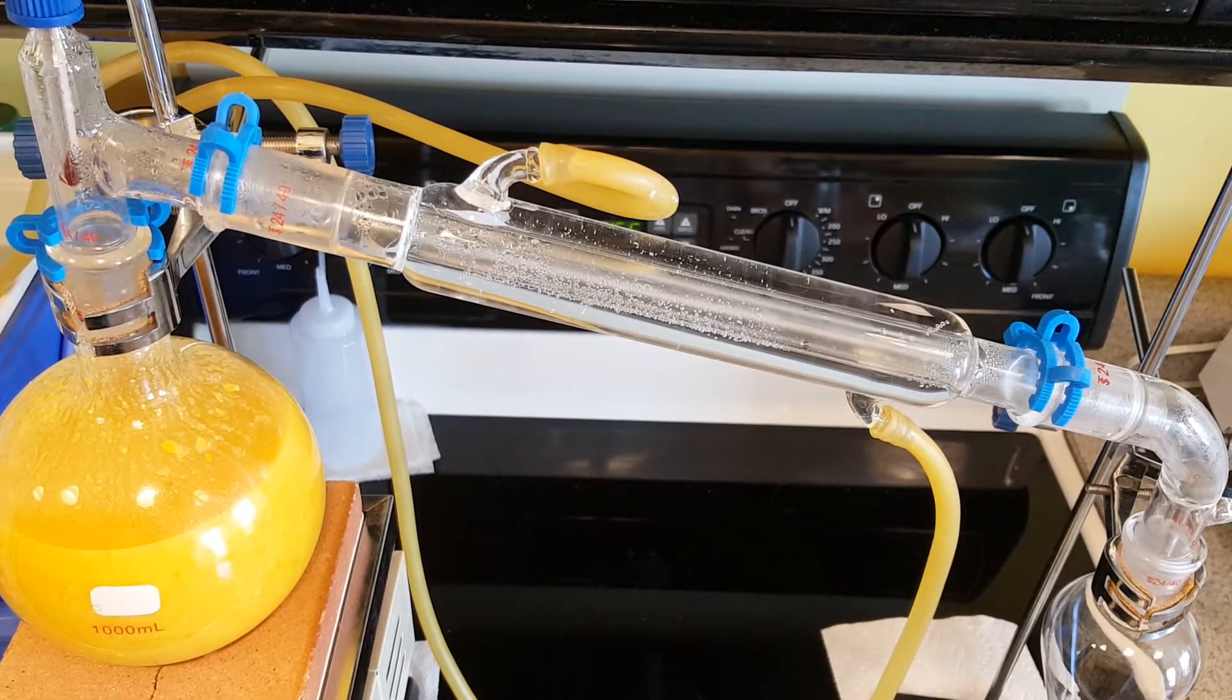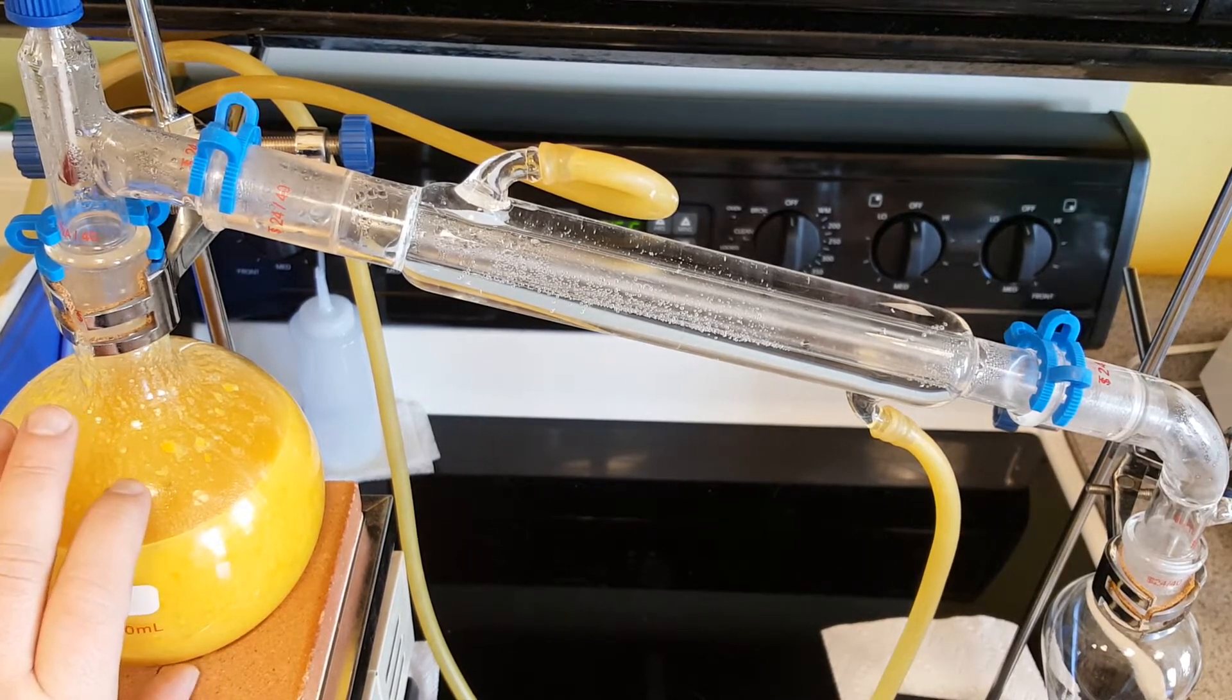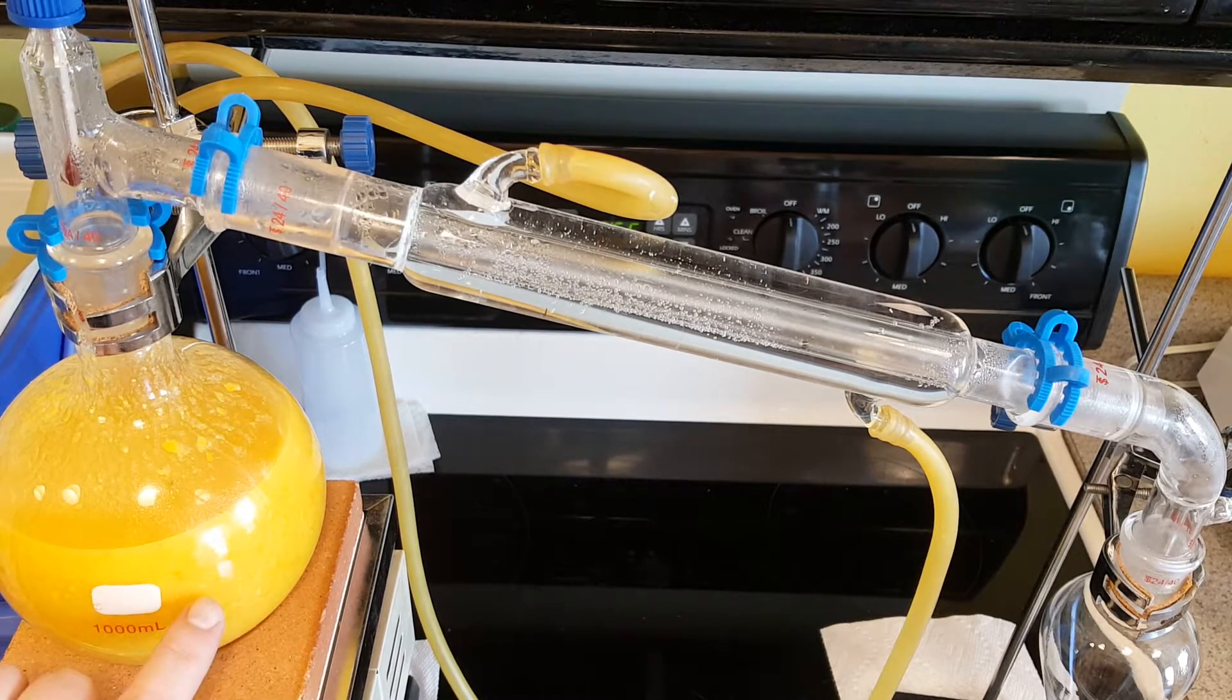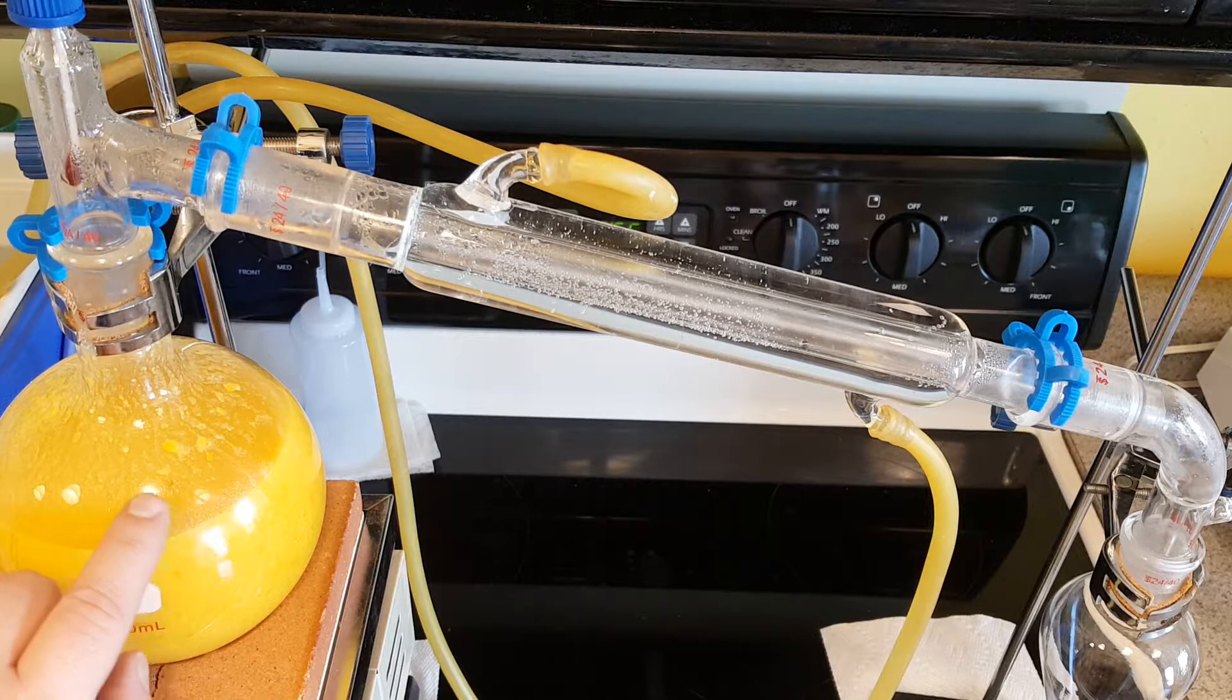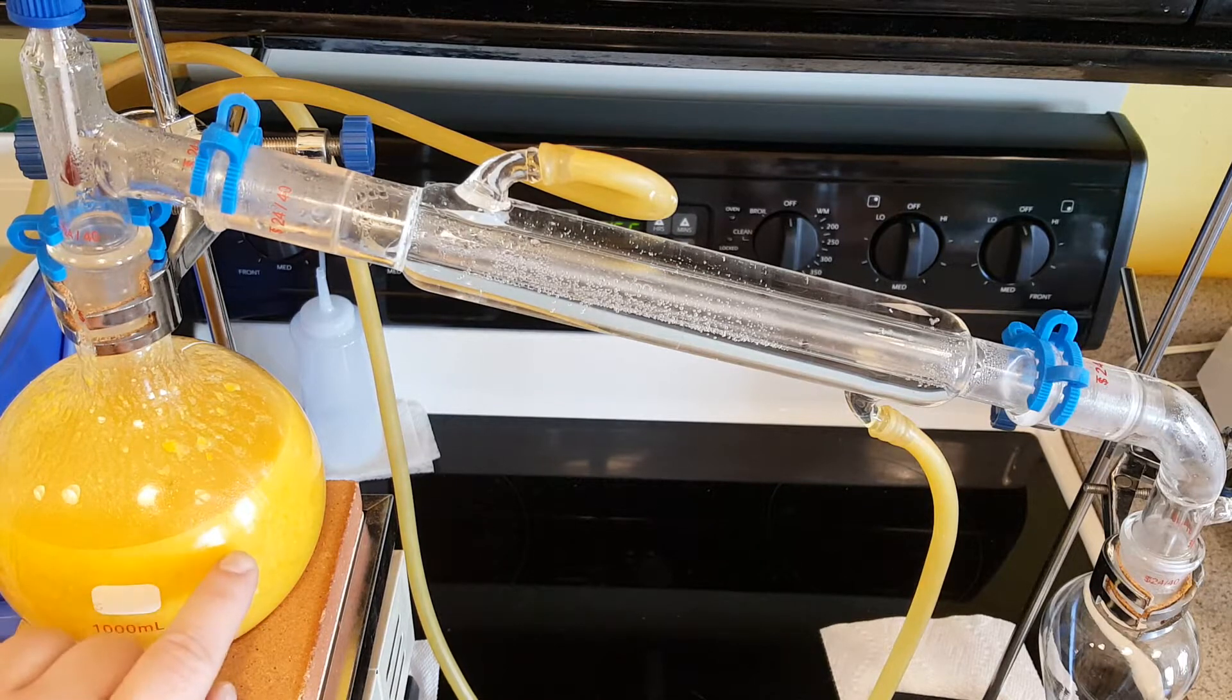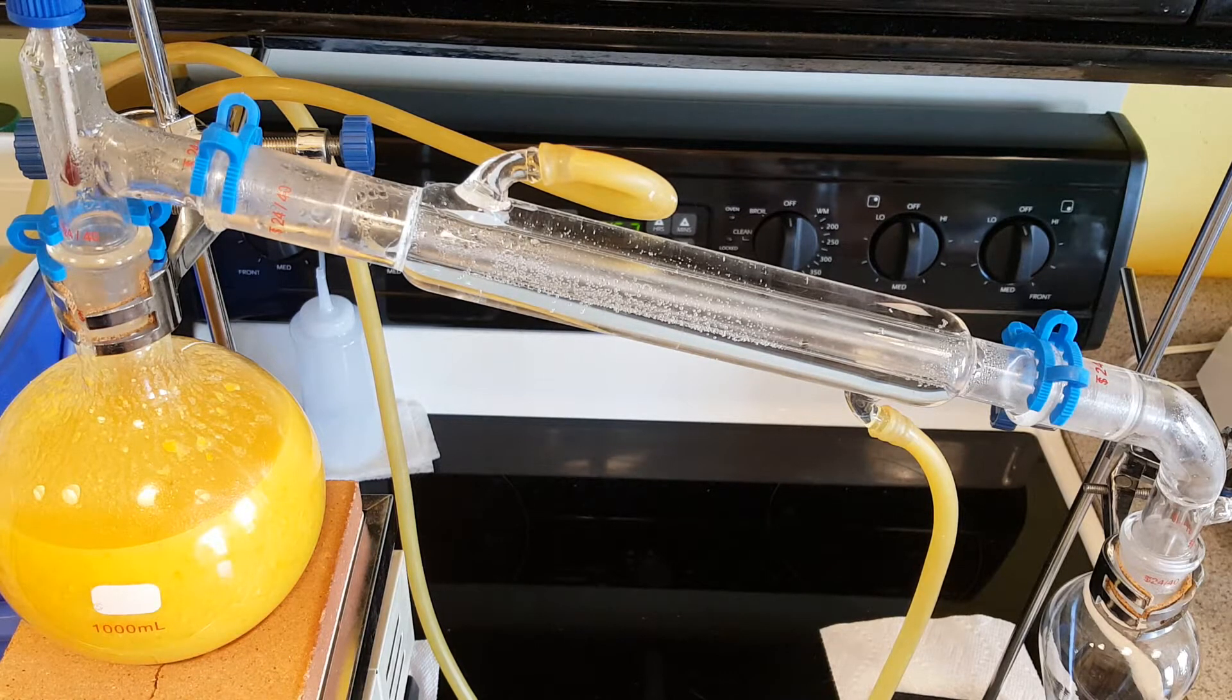My water pump is running and I have the heat on my distillation flask. This time I added some more water to the second batch so I have about the same level as I ended up with in the original batch. I started with a lower level and then I added some water when I noticed I had too much solids. I could add a little bit more, maybe ideally at the middle of the flask in case of boil overs, but yesterday the process went fairly smooth so I think it's okay to have a little bit higher level.